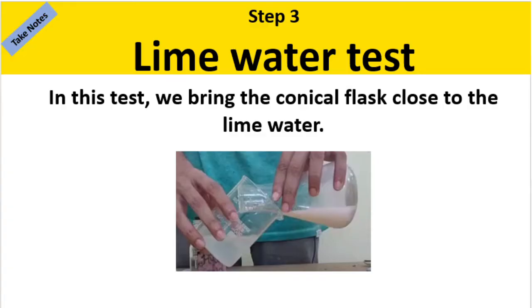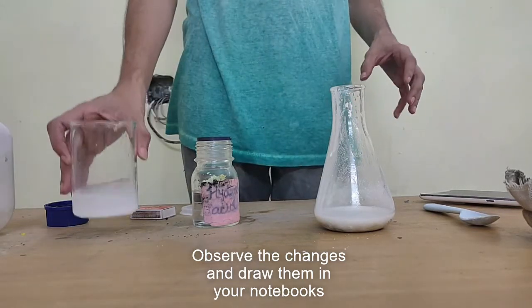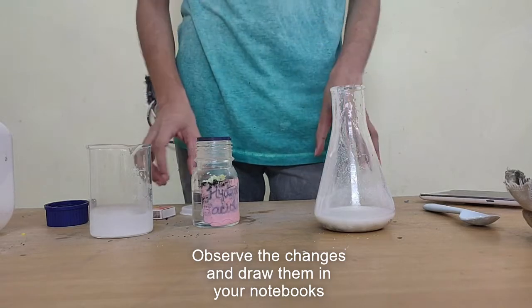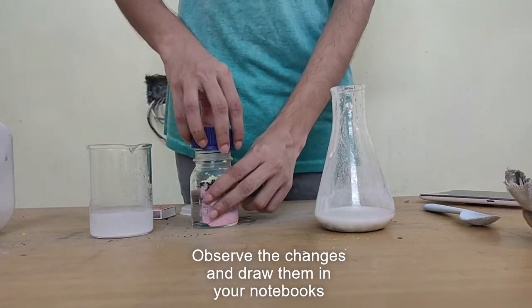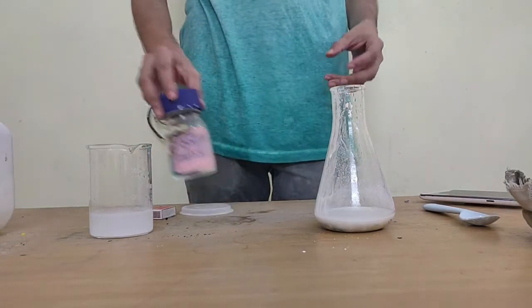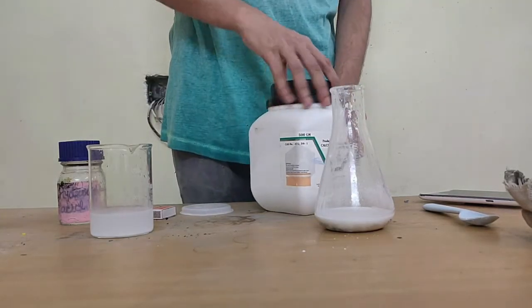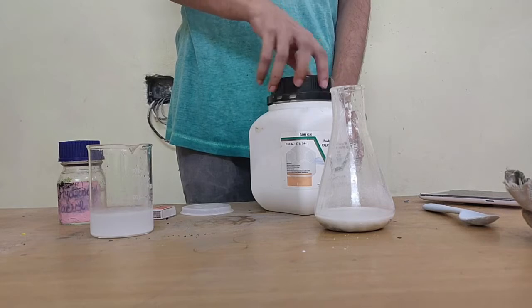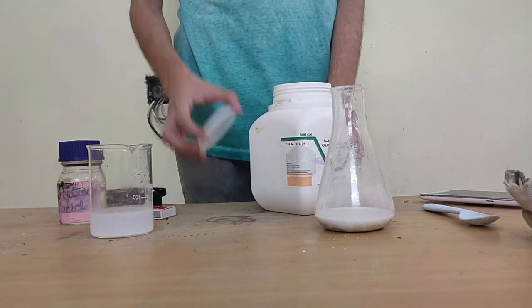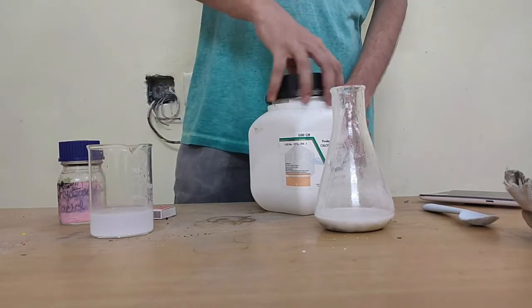So what happens is, if you noticed, the moment I try to pass the gas from here to here, it became a little murky. What we call lime water going milky. There are wisps of white smoke that form inside of the liquid, and the liquid, which was pretty much colorless, starts to become white. So this is one way to test for a gas called carbon dioxide.